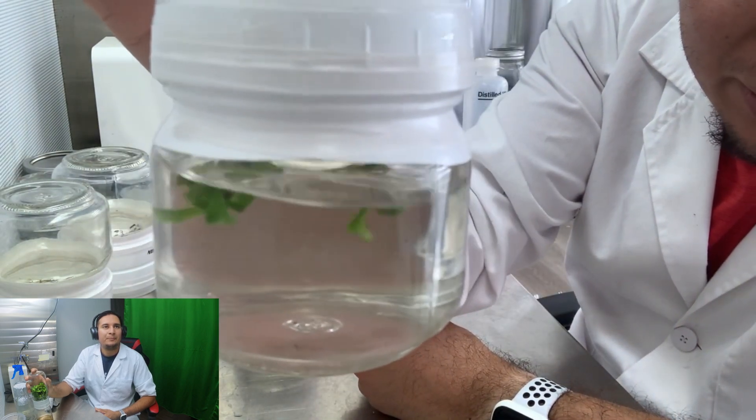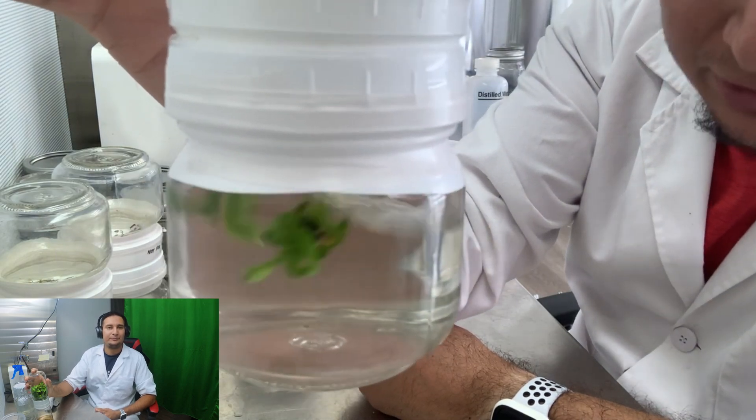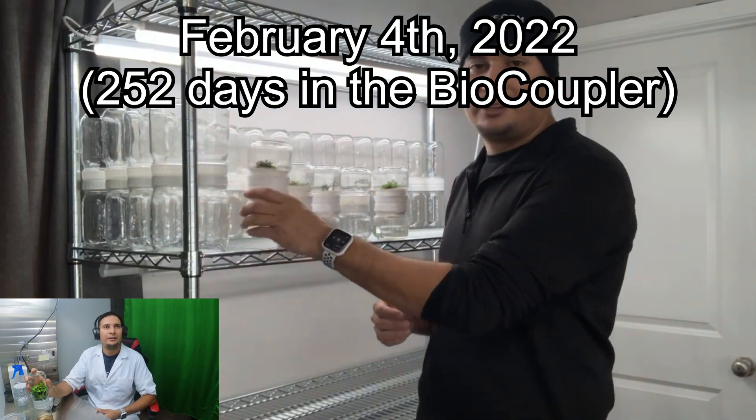Slowly moving this around — there are the plants, they look very nice. Hopefully they can propagate more. I use the same media for all these plants, hopefully they do well.